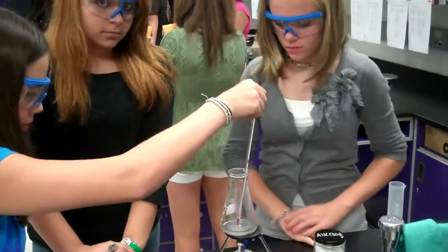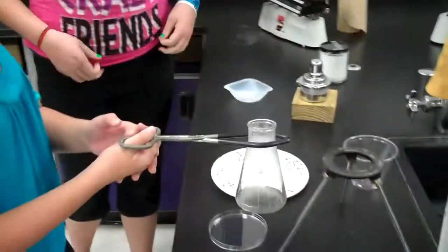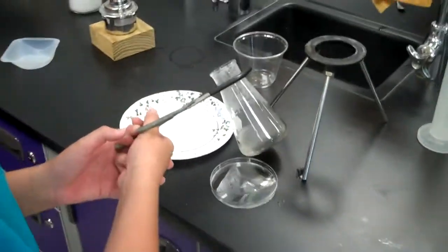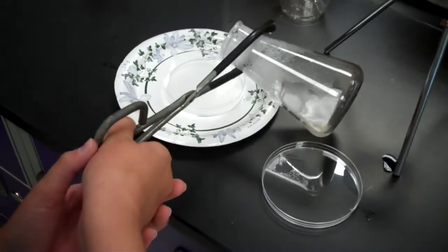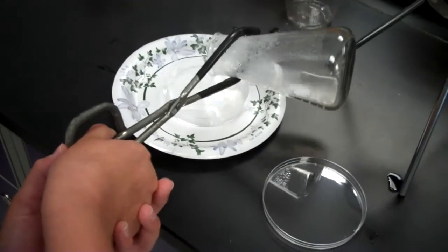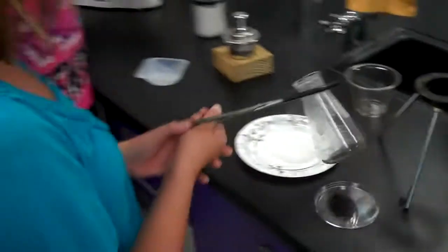Okay, it's day one of the Crystal Lab. Here we are pouring the dangerously hot liquid into the Petri dish. I'm scared. Come on, you can do it. I'm working on it. You can do it. Beautiful. Yay! Alright, success.